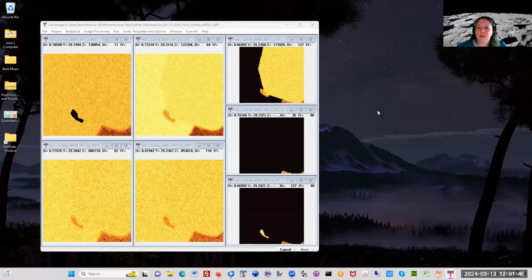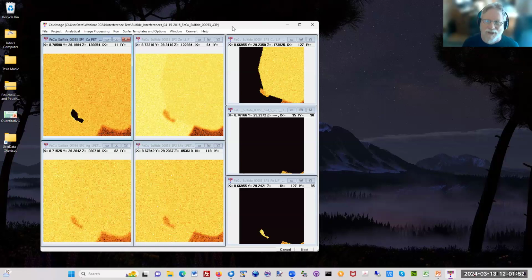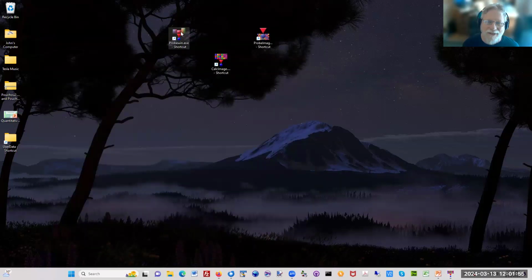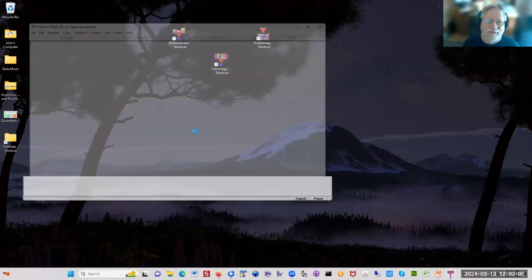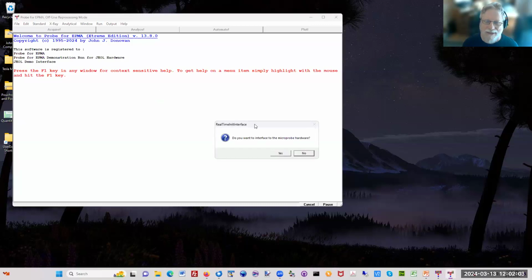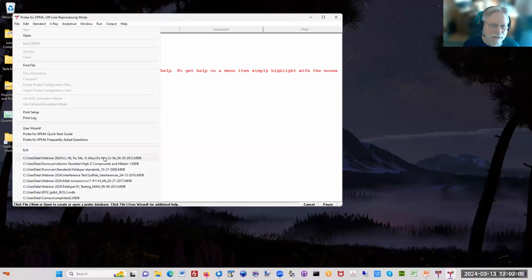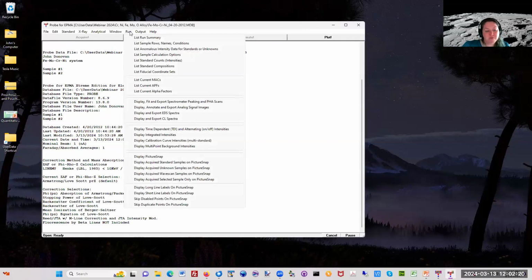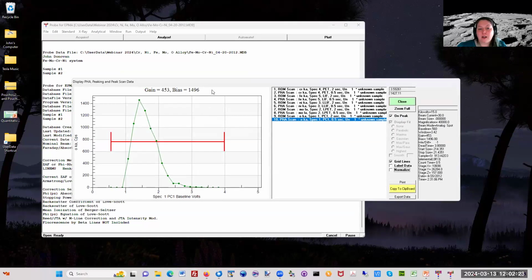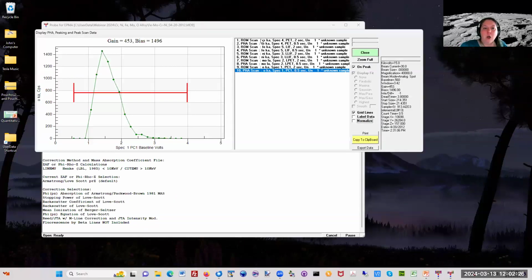And if I run it in this mode... I'm just going to show something really quick for people, because I think this is actually maybe the best feature in the software, the fact that it saves everything you do. And so if you want to reprocess data offline, that's great. I'll just open up a file. And you can export it all into Excel spreadsheets and whatnot. So you can just export it all and look at it.